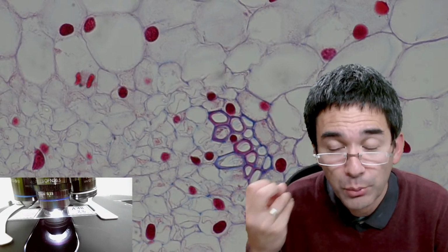Yeah, and I actually read a report somewhere that some folks got an award for solving the mystery of the cell wall, because they somehow were able to prove that cells have living contents, which is actually the thing that's alive. Yeah. Over here, also you can see that not all cells have an equally thick cell wall. So this one over here, it's much thicker, also because it's important for support.